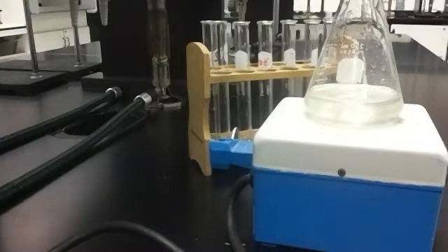And so basically what was going to happen tonight is that we were going to have 4 different groups. Each group was going to run this reaction with different concentrations, and we were going to time how long it takes the reaction to take place, and from that we would measure a rate of reaction. And then we can use the method of initial rates to write a rate law for this reaction.